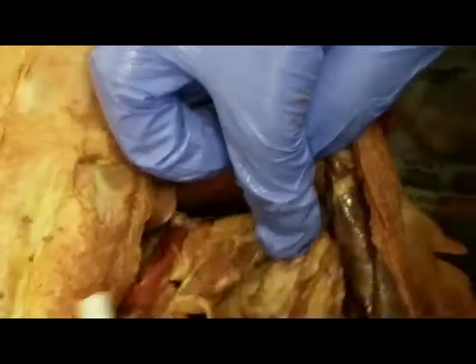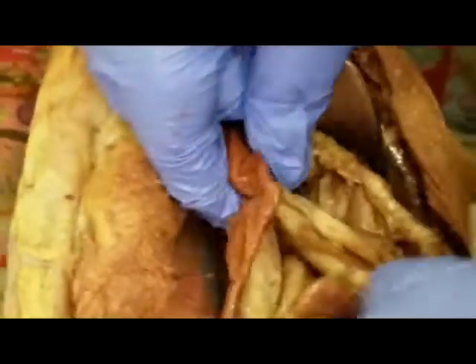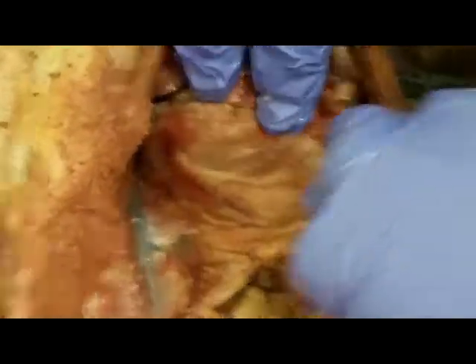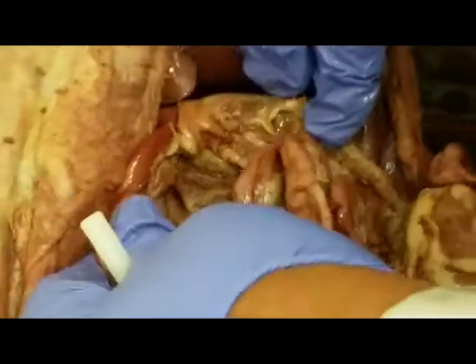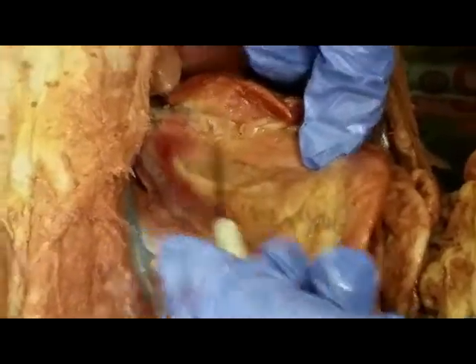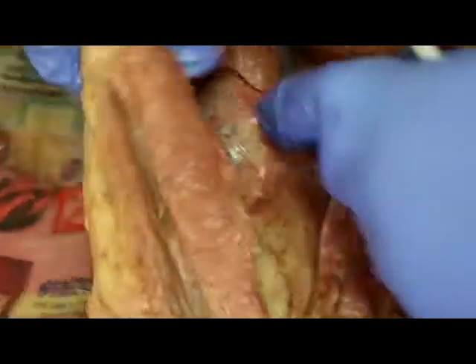And right behind the stomach, you have, so when we take the stomach and lift it up, behind there you'll have, this is the pancreas, hiding behind the stomach. That's the pancreas right there. Now, this is where your test is going to be involved.